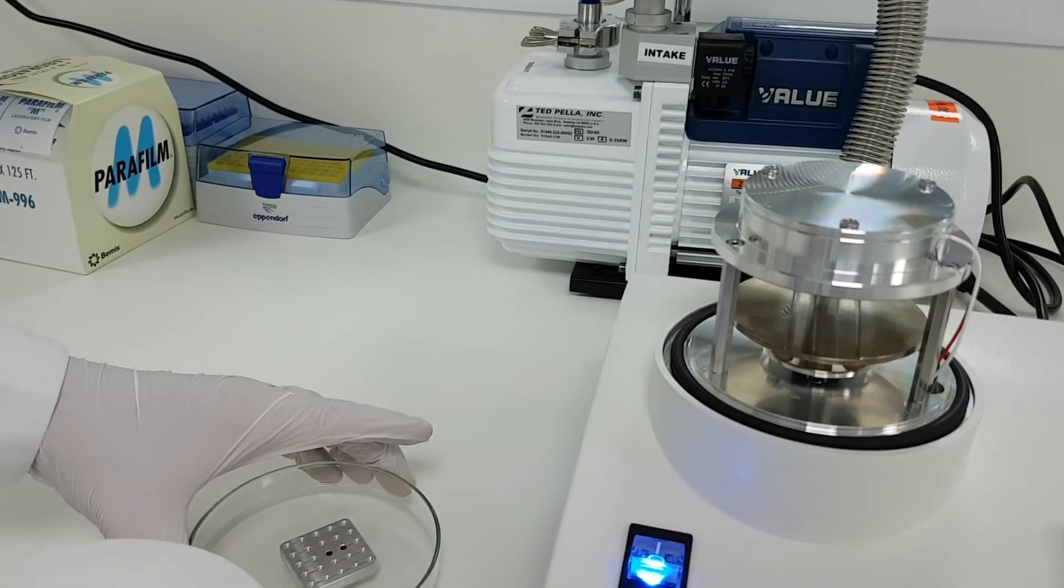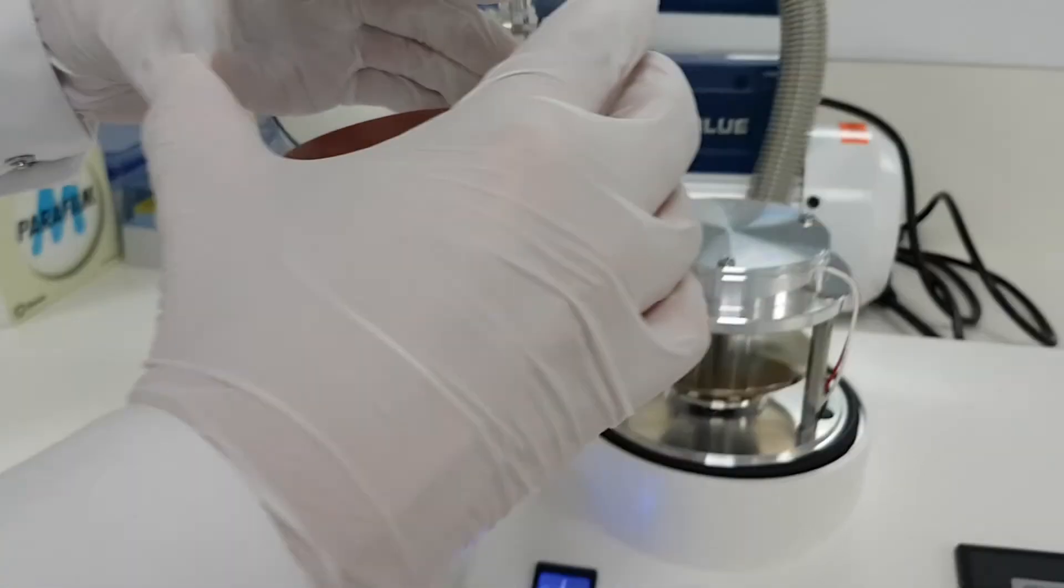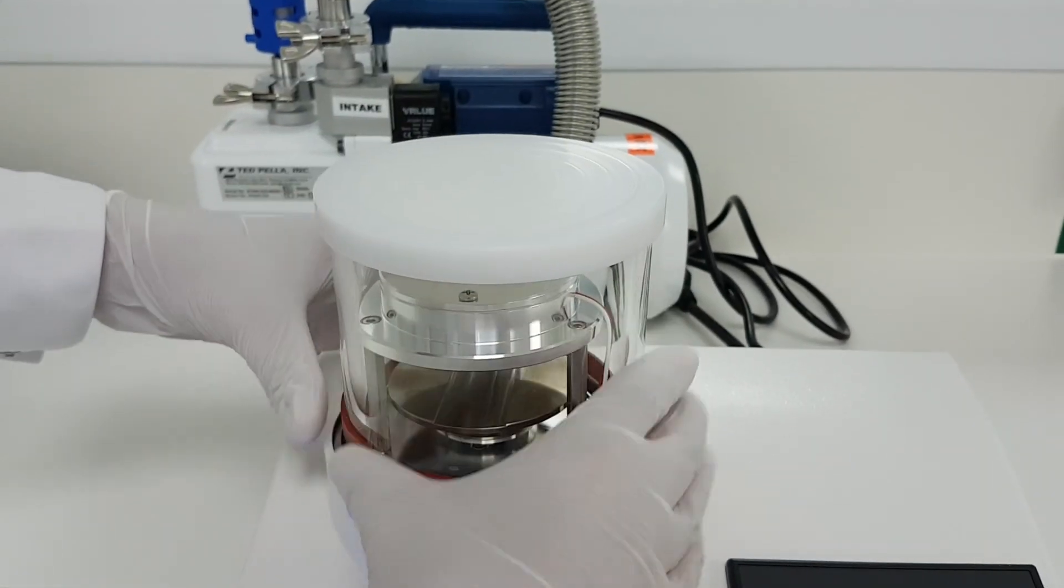The grids are now hydrophilized and can be used for specimen preparation. Ideally, the grids should be used within 30 minutes after the glow discharging.